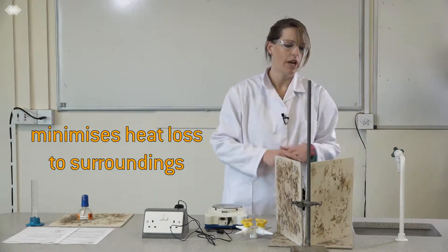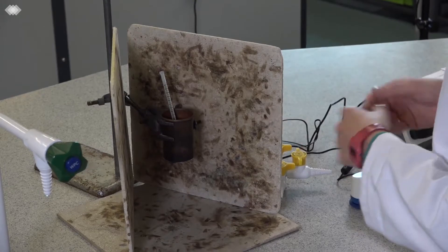You can see here the equipment's set up so you've got a heat shield to prevent any of the heat being lost.